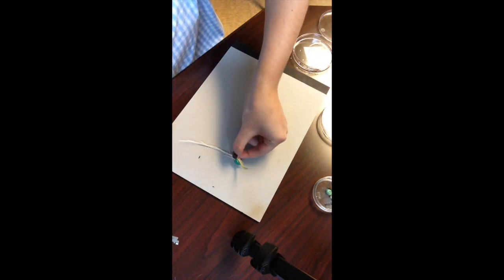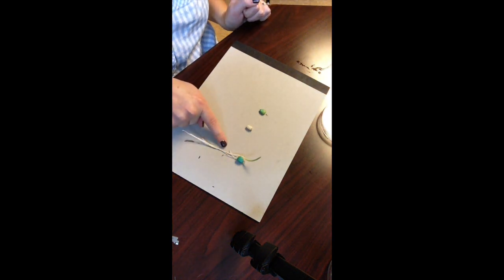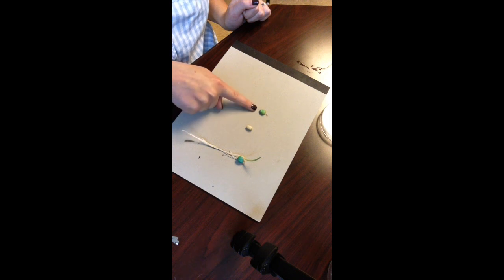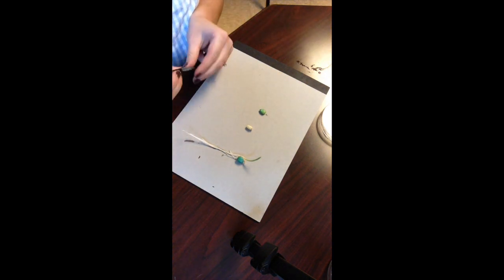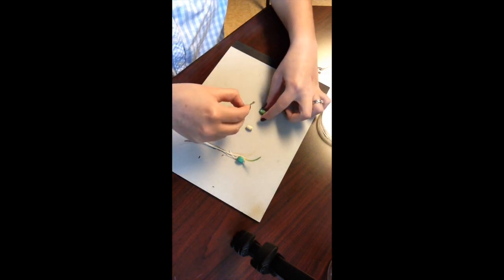This here is my corn seedling. The blue color is a fungicide treatment that is applied to field corn. The white kernel is sweet corn, and that blue kernel is the same. Both of these have not been germinated yet. They've just been imbibing in water. I'm taking a razor blade, and I'm going to use this to cut my samples.